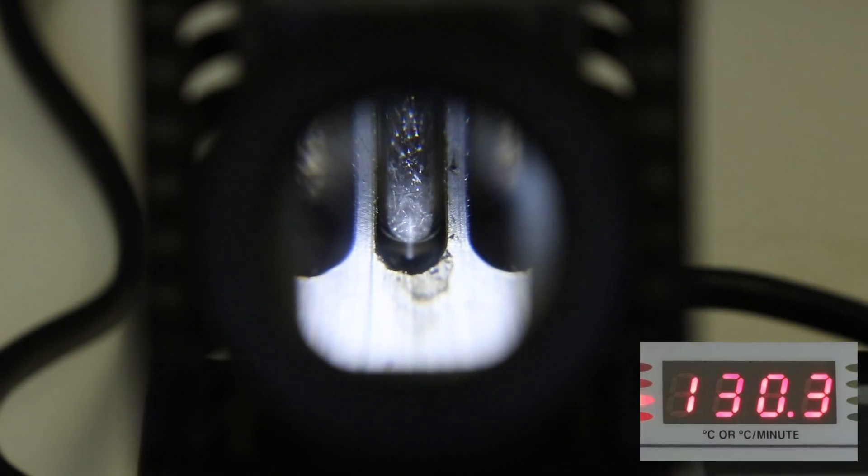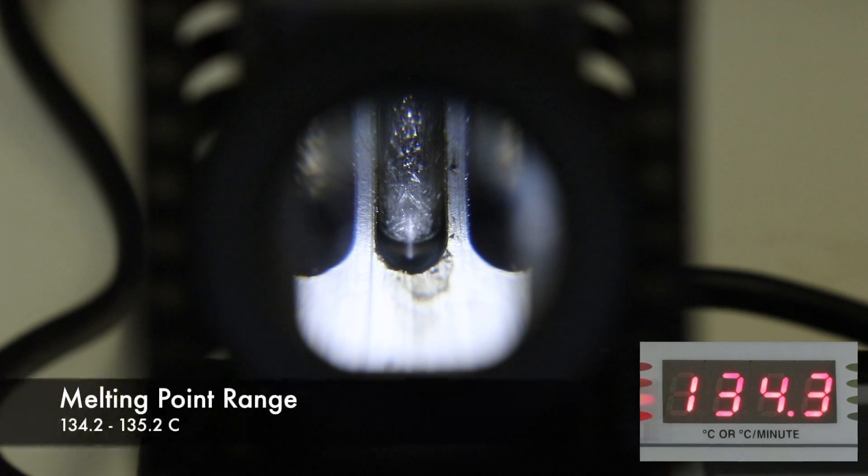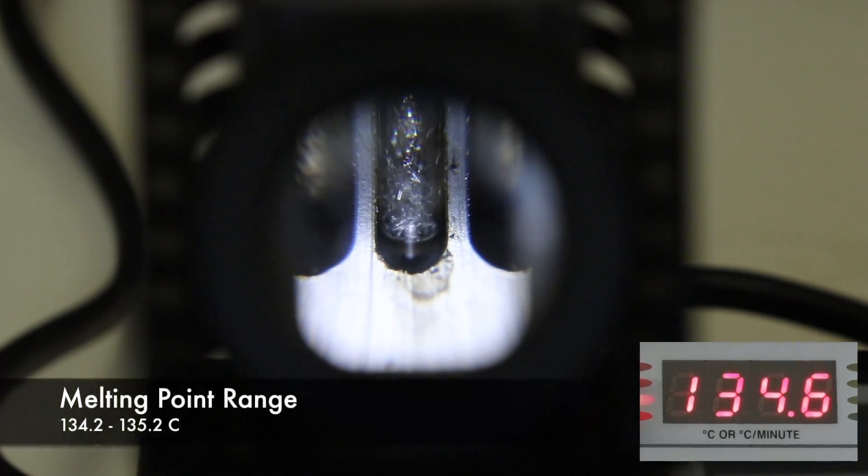I'll get the melting point range for the product now starting a few degrees below 135 and it looks like this starts melting around 134.2 degrees and finishes around 135.2 degrees celsius.